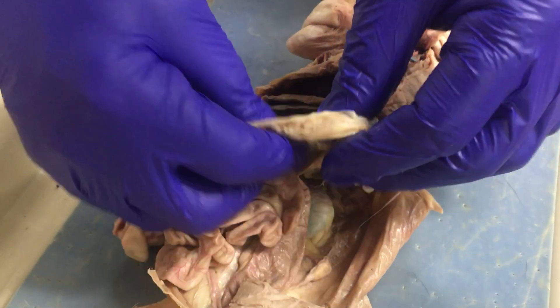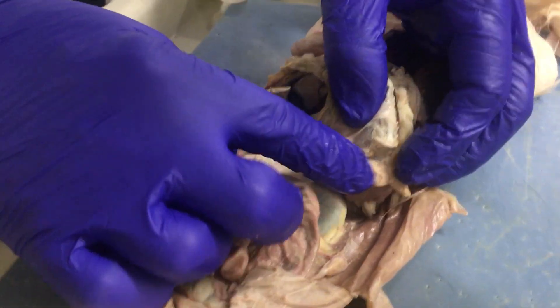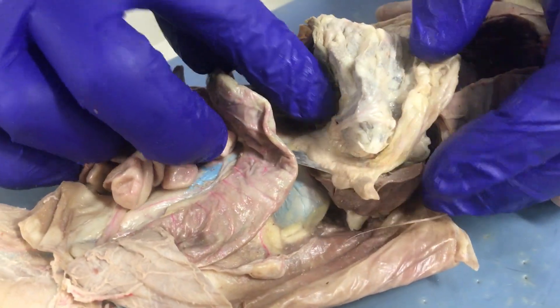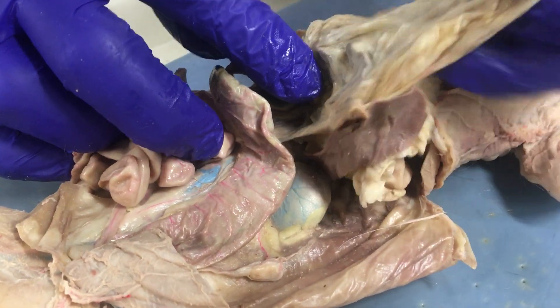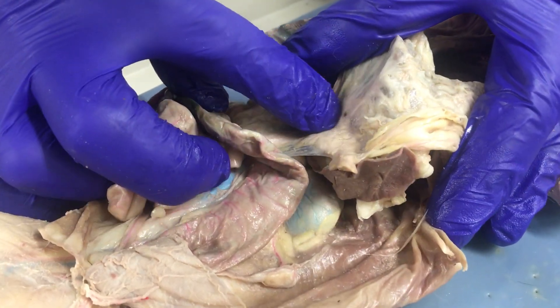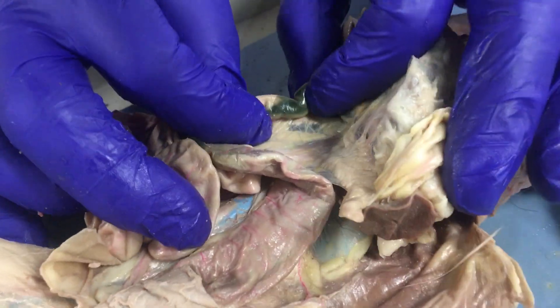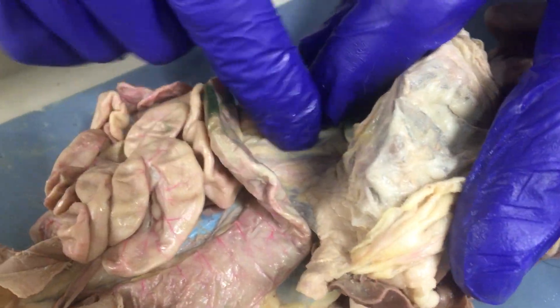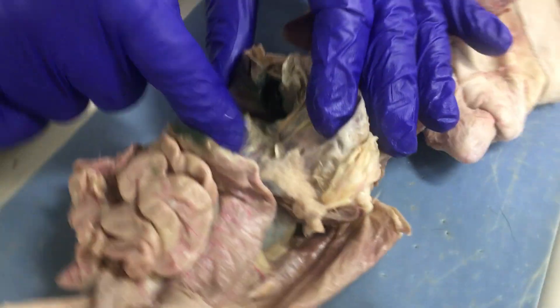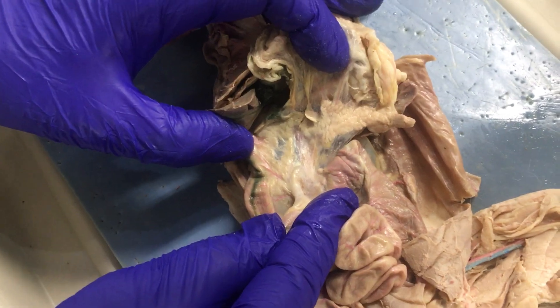We also found the pancreas. If I lift this up, I see this pebbly glandular tissue running right under the stomach at the base of the greater omentum. It actually runs along here and then down along the side of the small intestine, making the shape of an L. That pebbly structure helps you identify it as the pancreas.